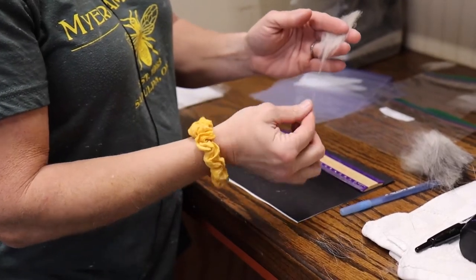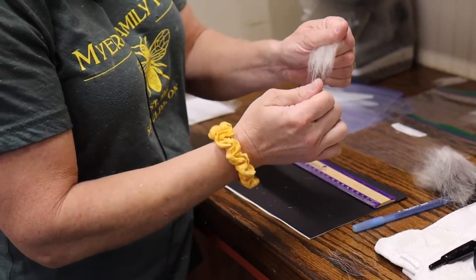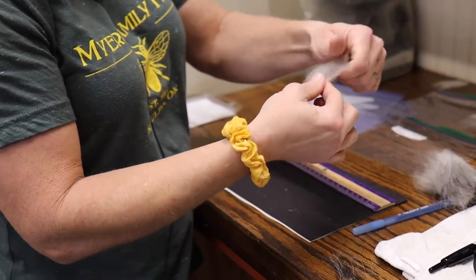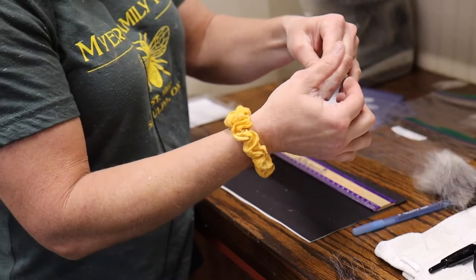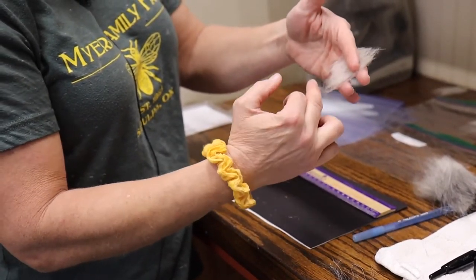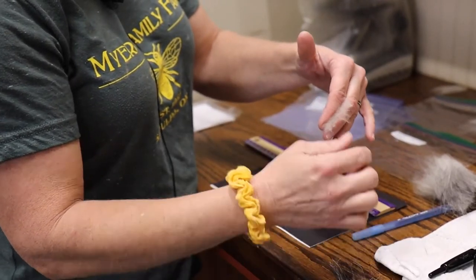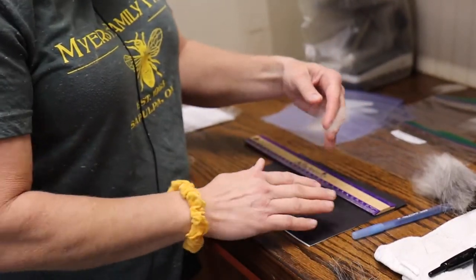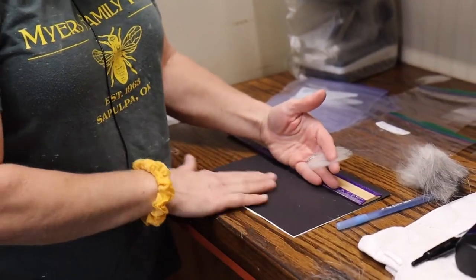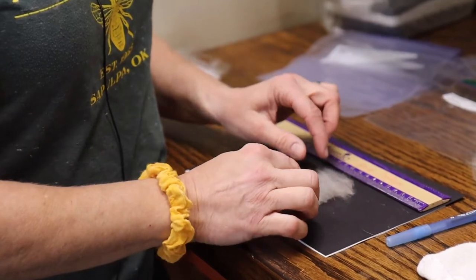I'm going to tease these out. I'll hold the other end and pull some of the ones that I think are not truly end to end on the sample, until I get a sample that's spread out and I can see where the tips are and can clearly see where the cashmere starts. Then I'll lay that down on a piece of paper that is a contrasting color to the color of the cashmere.